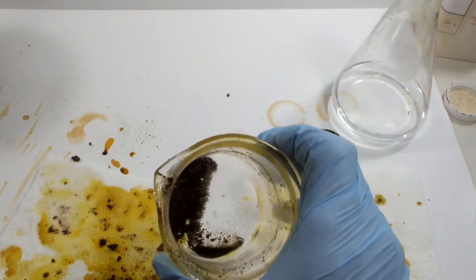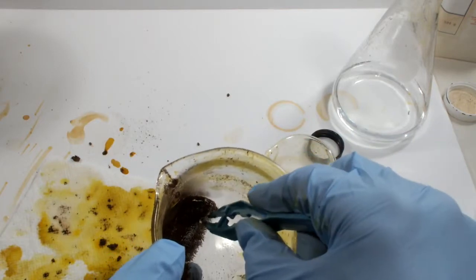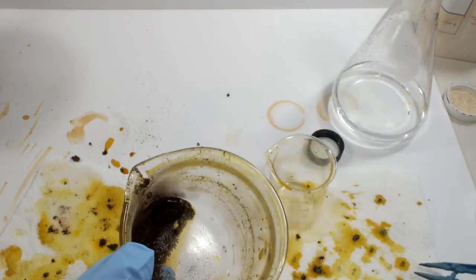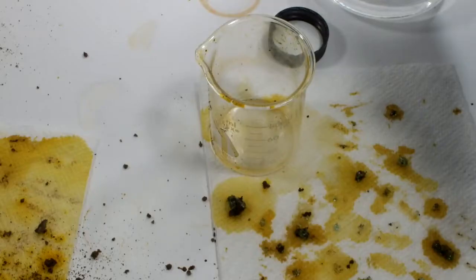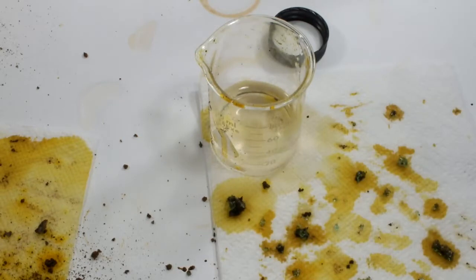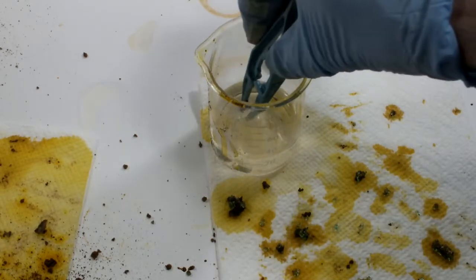Here's a good shot of the panning process. Can you spot the crystal? Yep, there it is. And yes, it's really that tedious. Once I got a bunch of the crystals on the napkin, I'd give them a quick rinse, pat them dry, and then put them into a storage bottle.